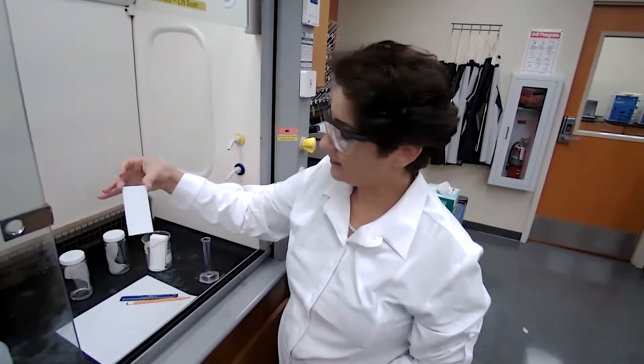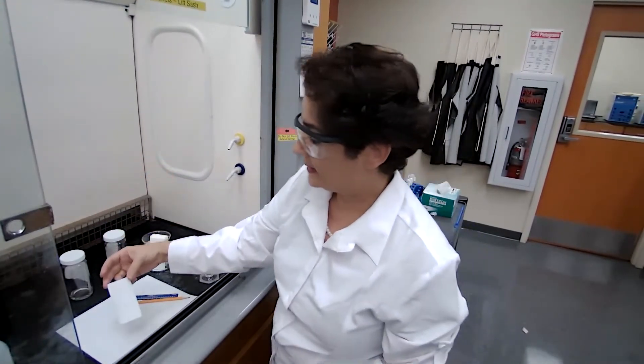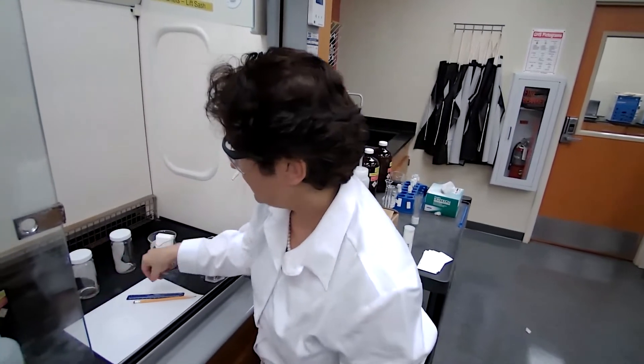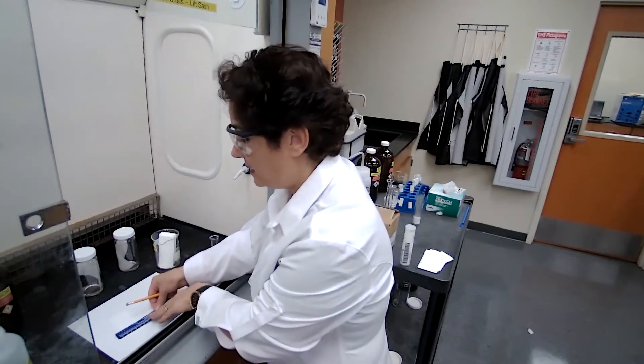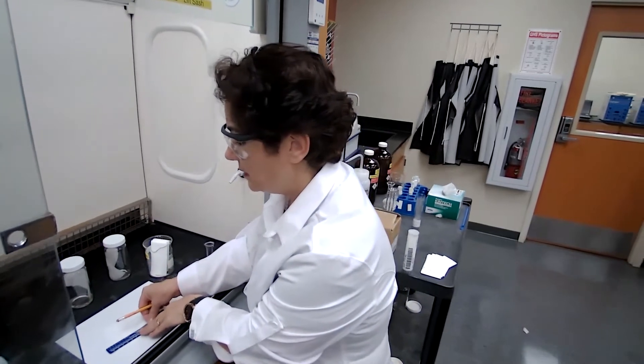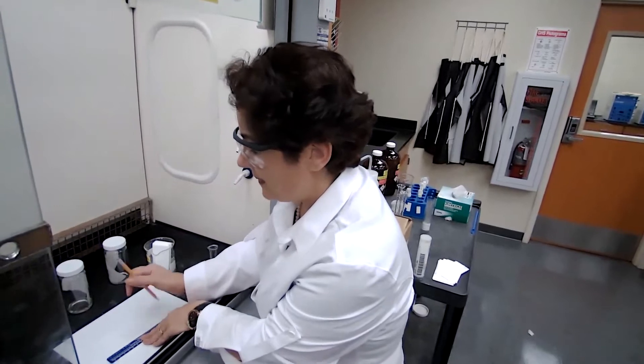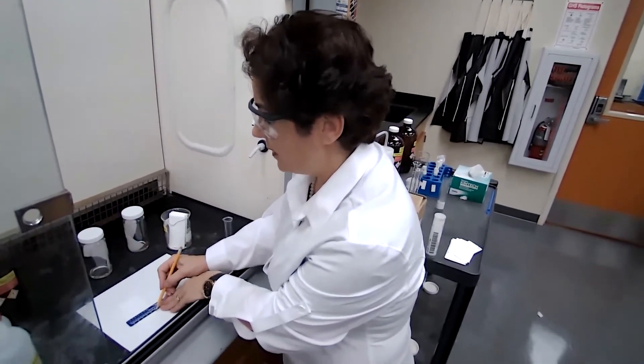Make a line, the sample line, which is about one third of an inch from the bottom of the plate.